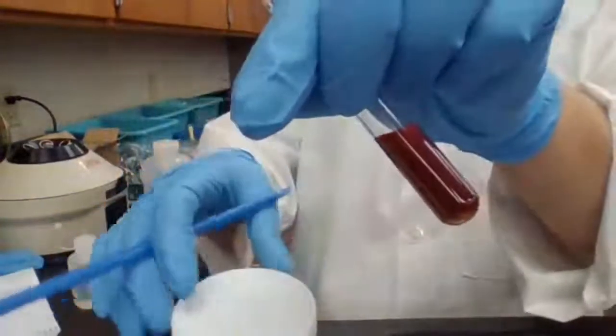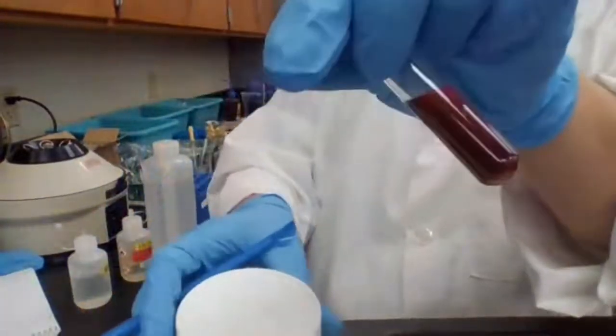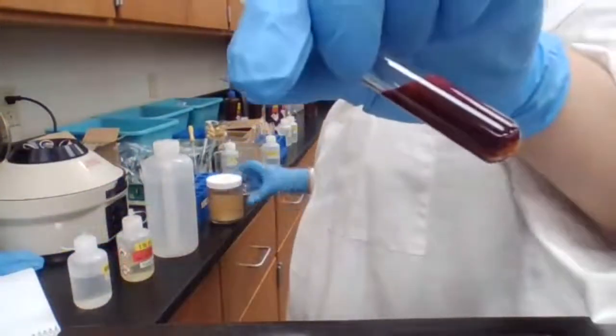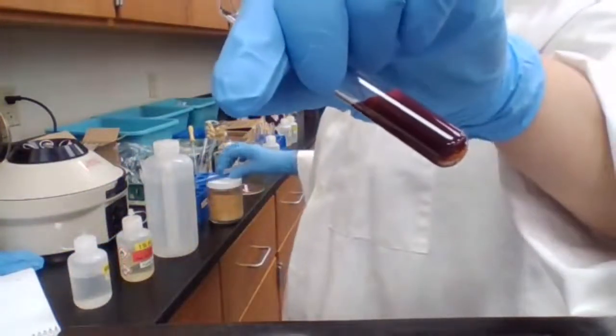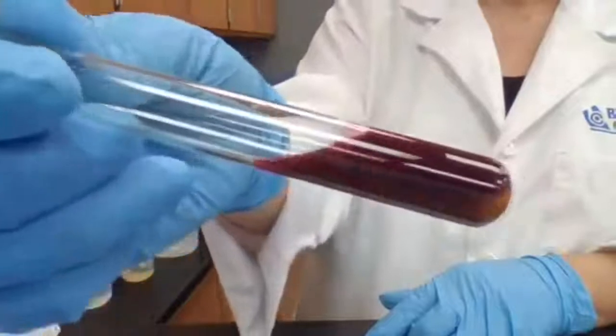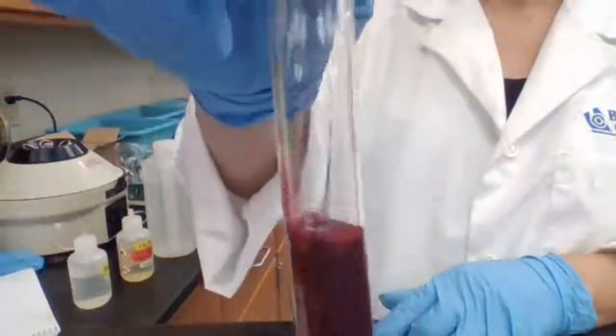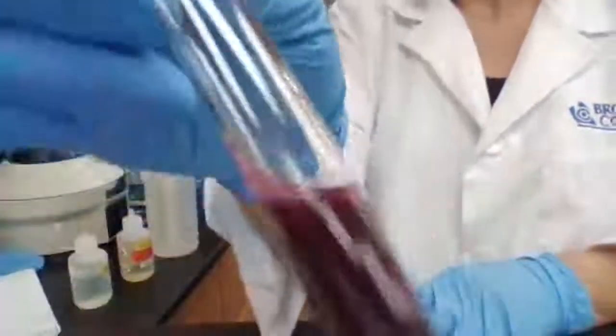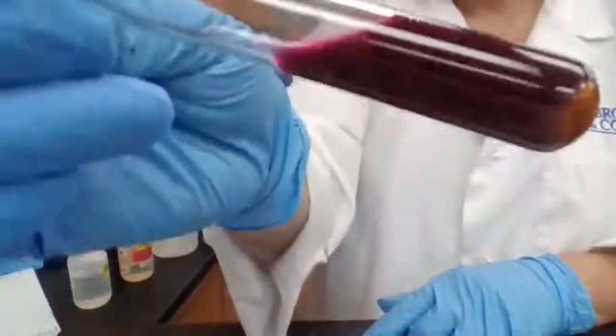Okay. After adding the reagent, this is for part 3G. Record your observation, so record your observation in order to identify presence or absence of ion from part 3G.